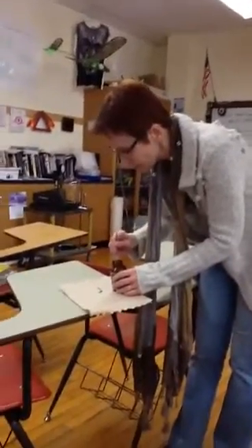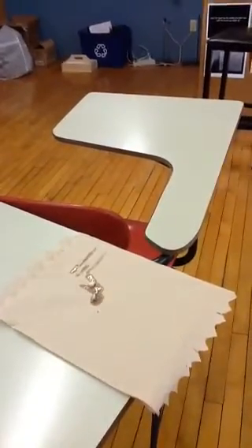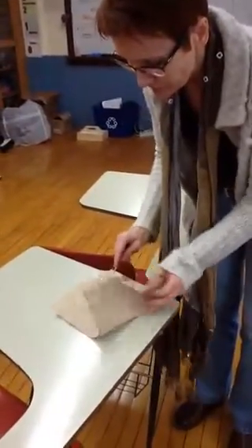A little chunk of sodium in oil. Why do we keep it in the oil? To keep it away from water. If I leave that out too long, all the oil will kind of soak into the paper towel and the moisture in the air will cause it to react. So we'll use it fairly quickly.